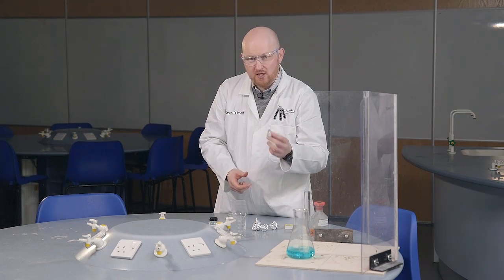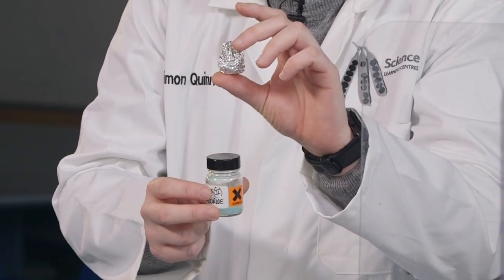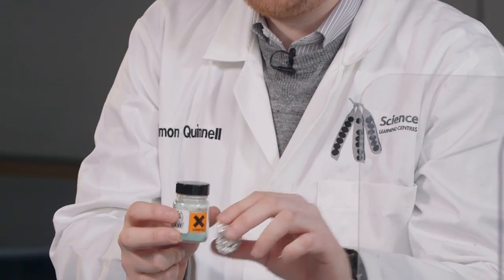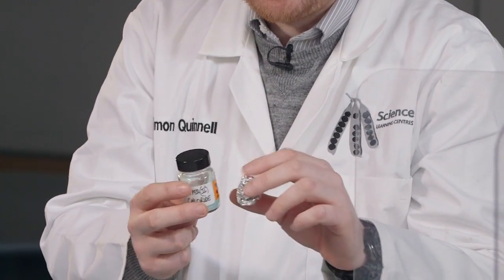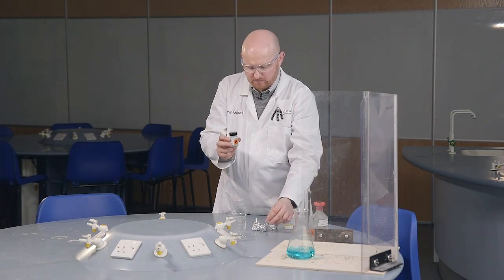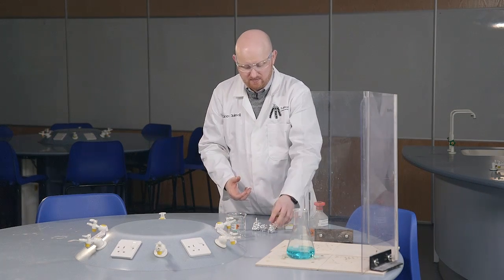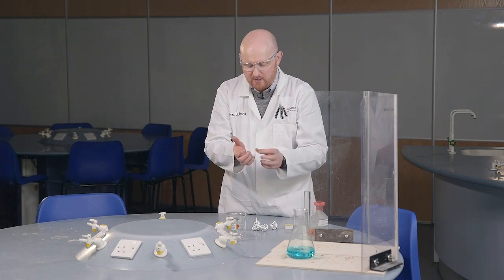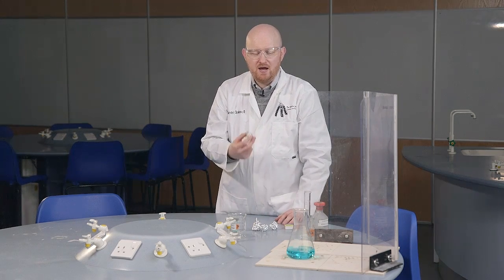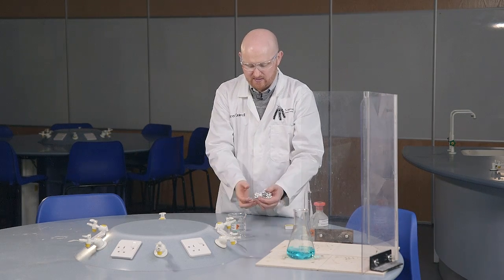Our aluminium is more reactive in the reactivity series than copper chloride, so the aluminium will displace the copper out of the copper chloride. This means we'll get aluminium chloride forming and copper as a solid metal forming, which we'll be able to see at the end of the reaction. Because we also have hydrochloric acid removing the aluminium oxide layer, we'll have hydrogen being produced — and the hydrogen is what we're going to ignite to create our Northern Lights.